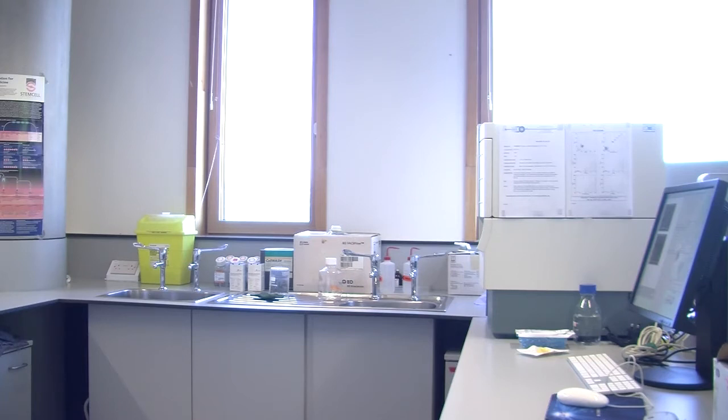Now, can you fix it by EDTA or pipetting or whatever, or vortexing, or not? If you can't fix it, you have to use another technique. If you can fix it, you can use cytometry, but can you fix it without affecting your data? And this is what comes from your years of experience and training. You have to apply different techniques. But always ask for stages.